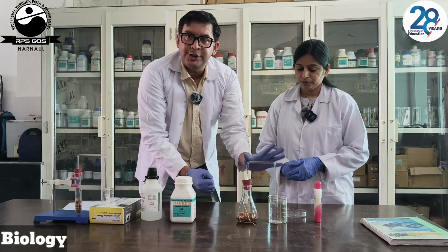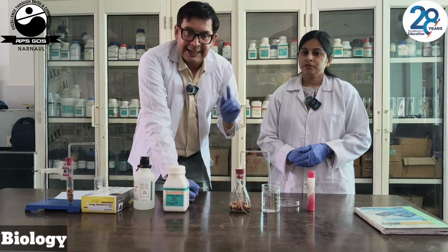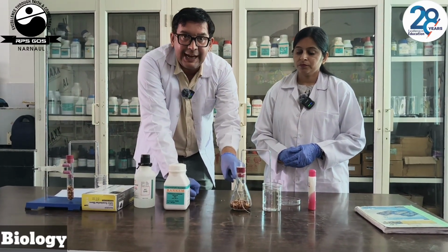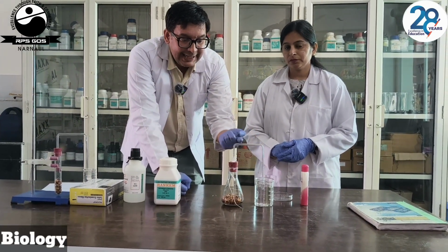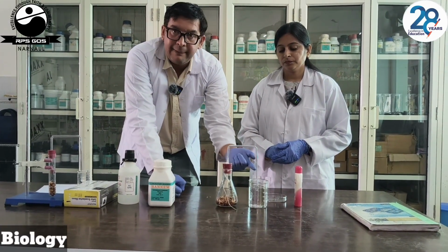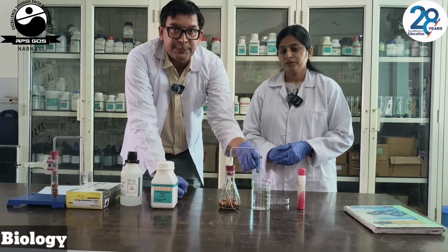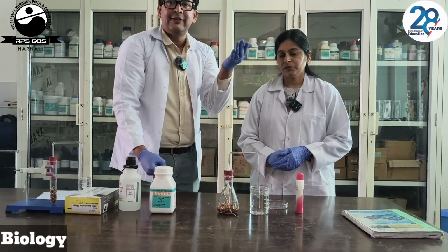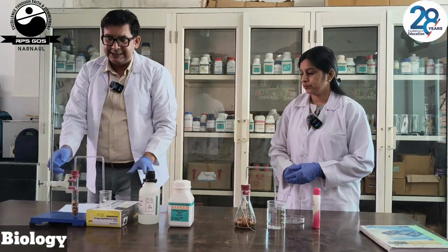This experiment shows that CO2 is given out during respiration, as the pellets have absorbed the CO2 and the air present in the bent tube is being used by the germinating seeds. Now, to fill up that space, the water level will rise up. This is the one method. Another, second method is this one.